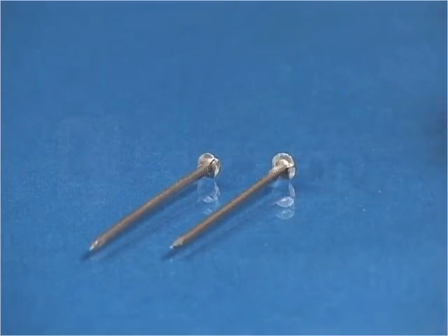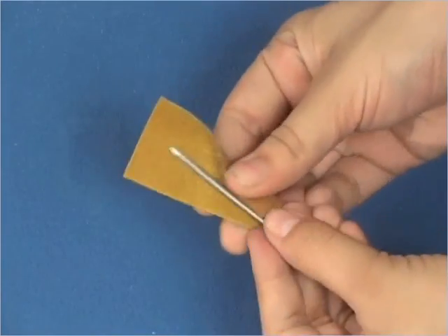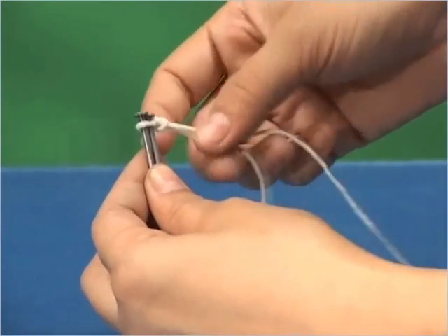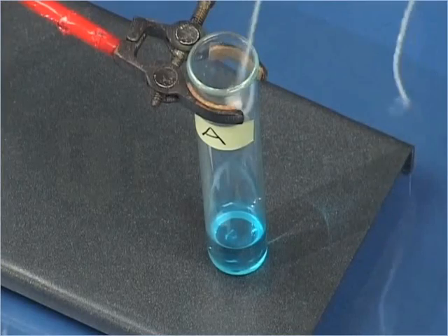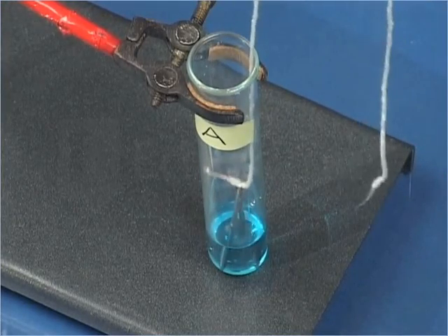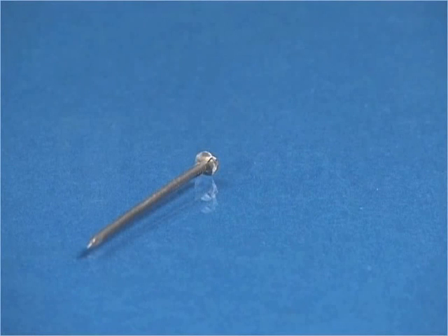Take three iron nails and clean them by rubbing with sandpaper. Tie two iron nails with a thread and immerse them carefully in the copper sulfate solution in test tube A for about 20 minutes and keep the third nail aside.